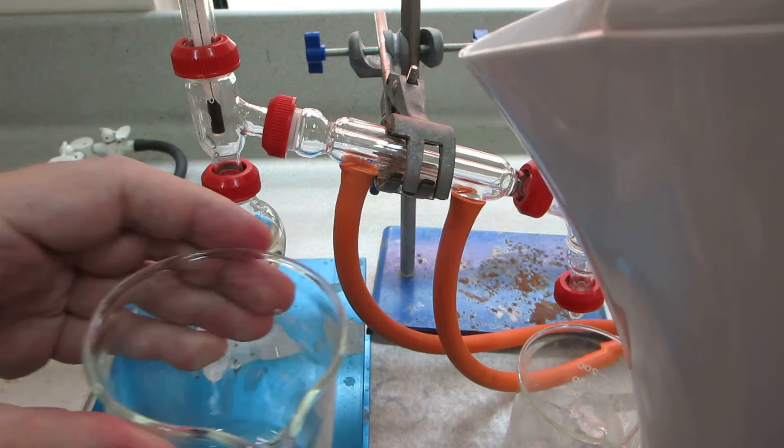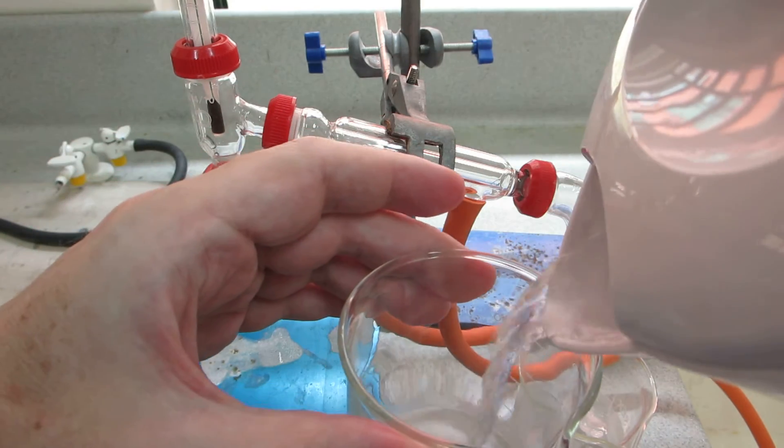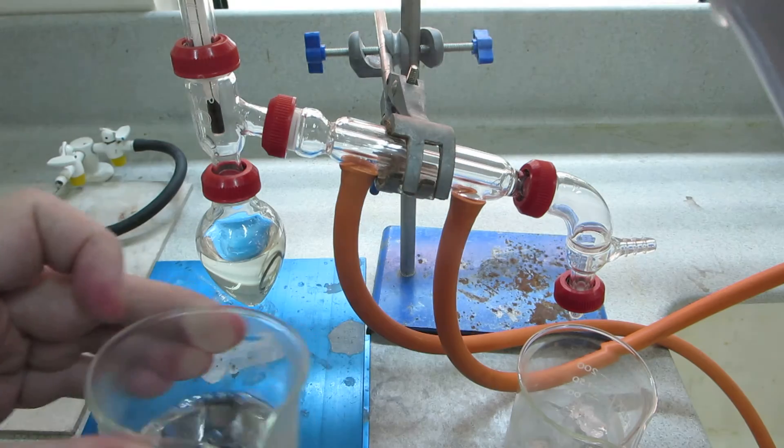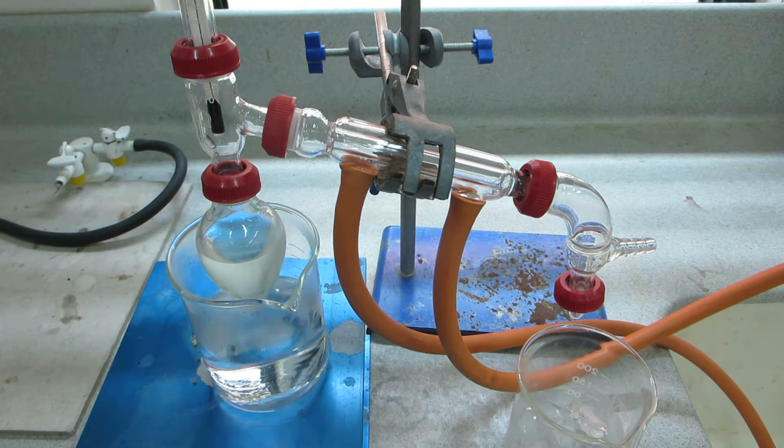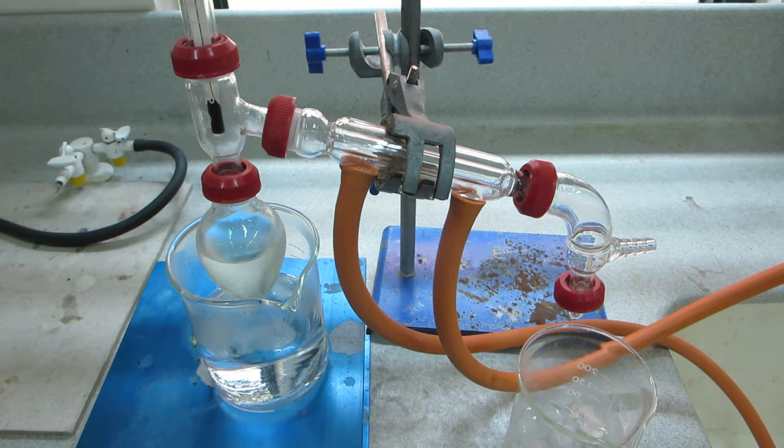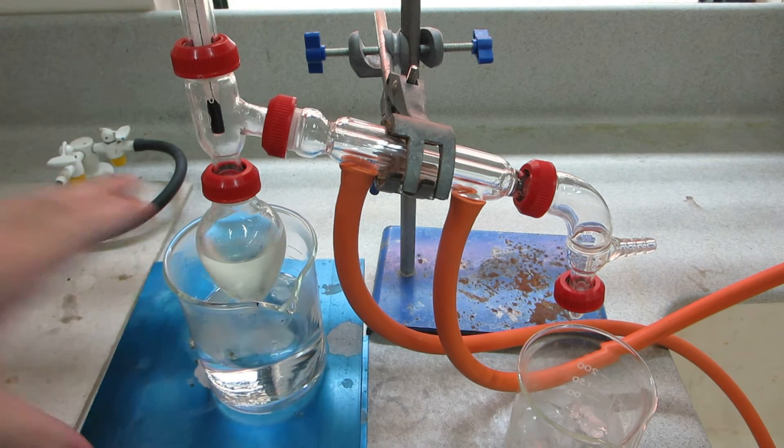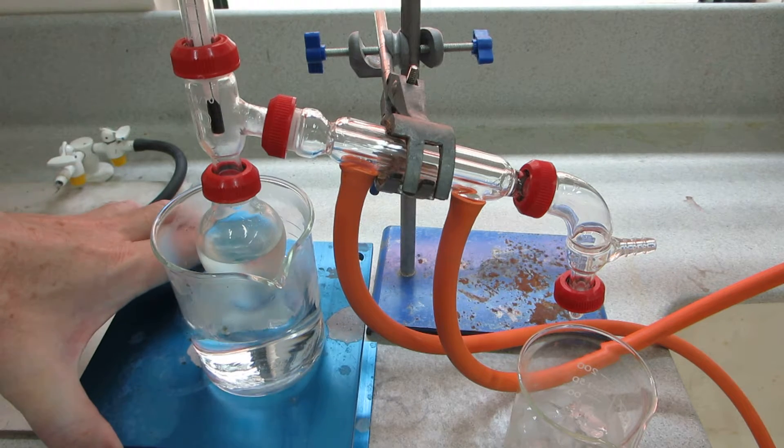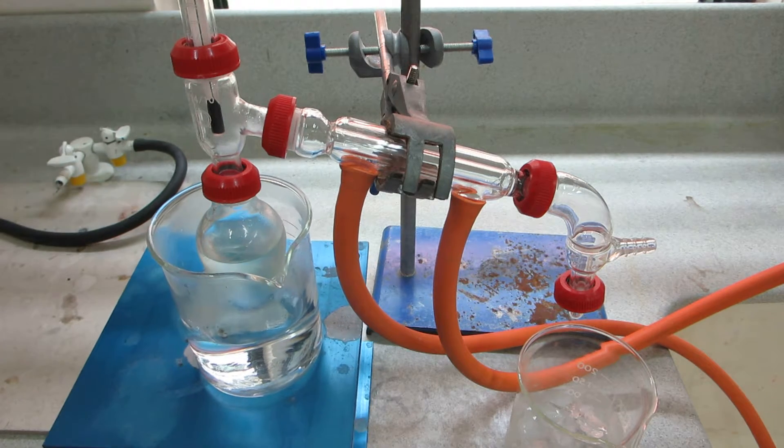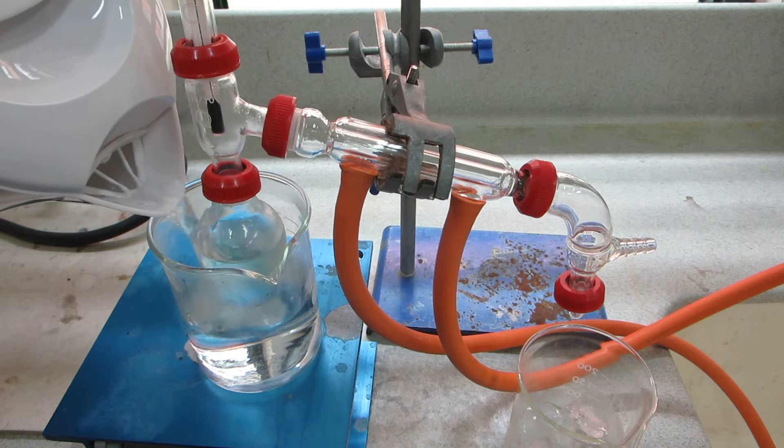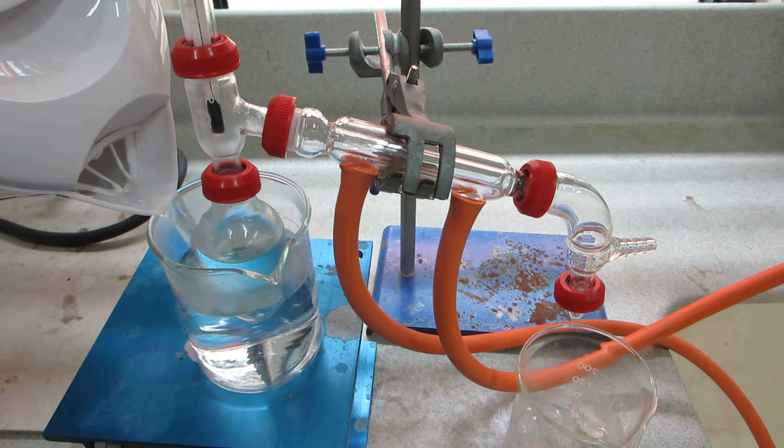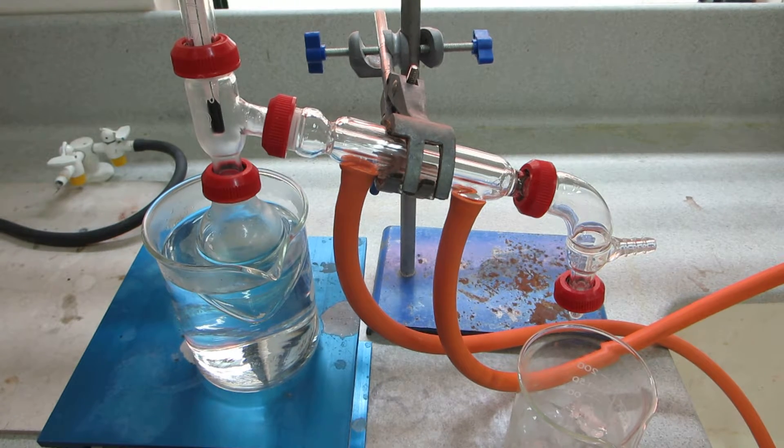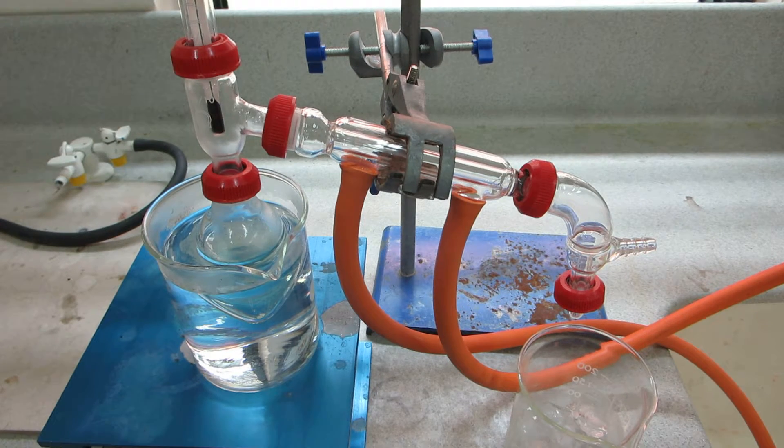Hot water from the kettle here. So, that goes from the water bath. That water's near to boiling.